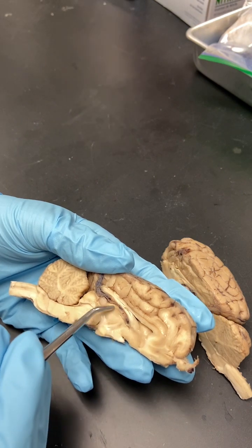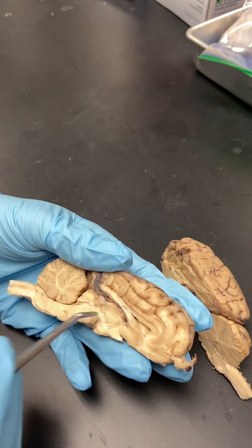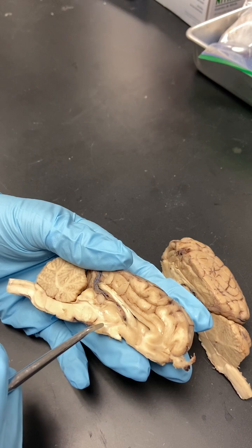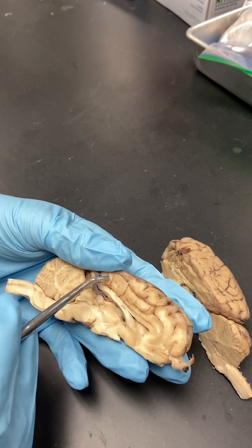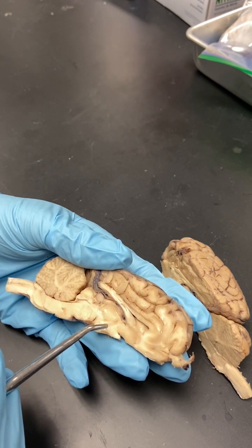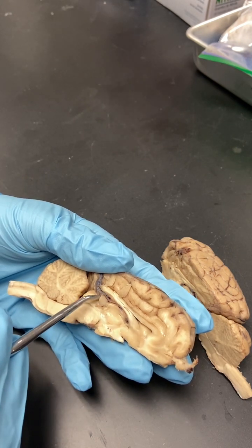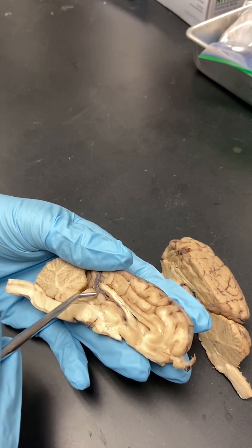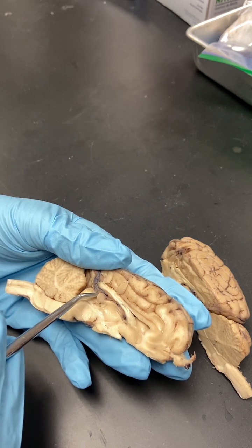The thalamus is usually a round shape, although it might be a little squished because these have been compressed for a while. And below the thalamus is the hypothalamus. So the thalamus relays information to all the lobes of the cerebrum. The hypothalamus plays a role in temperature regulation. You can remember that because hypothermia. And moving over here, this is the pineal gland. It got sliced in half during the cut, which is what should have happened. It's perfect. The pineal gland produces sleep hormones.